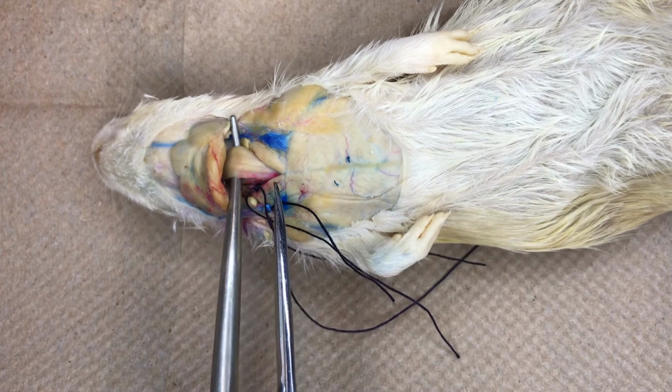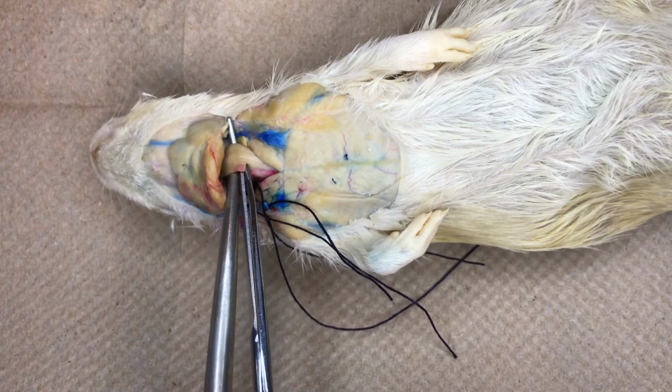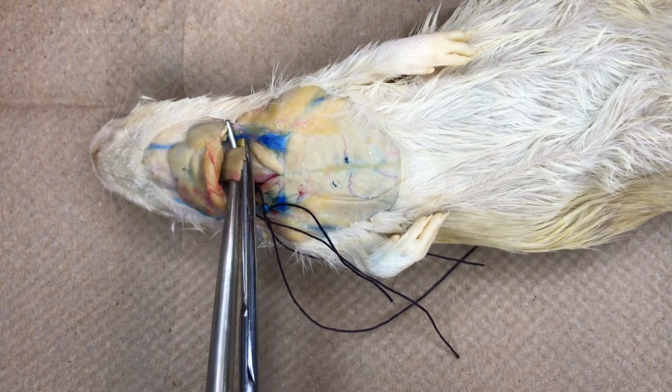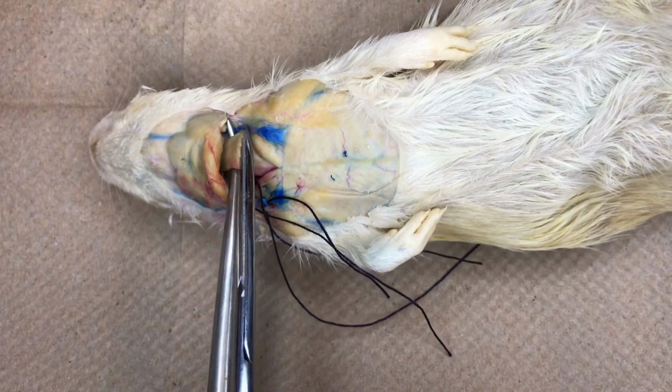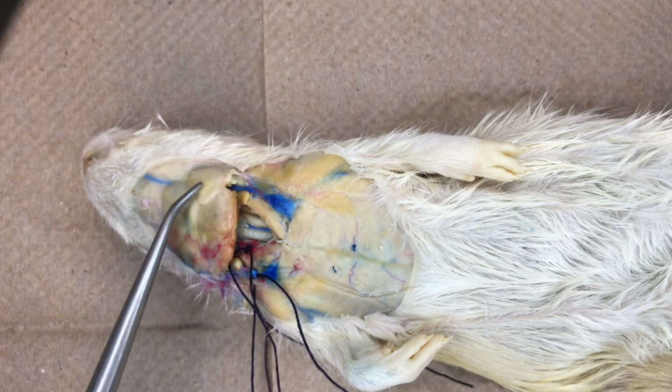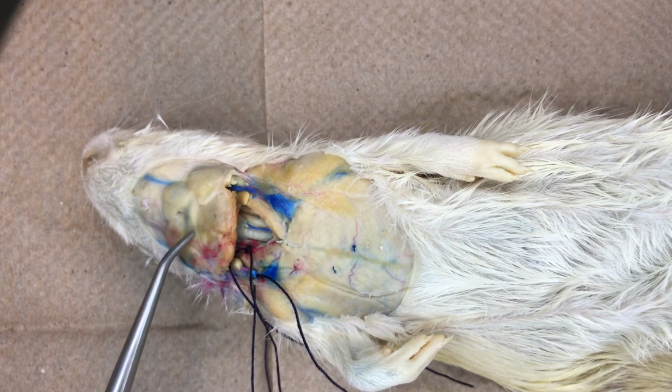To continue our dissection of our rat and expose the neck region, we need to cut the muscles of the neck. Now that we have exposed the neck region in your rat, we can see just under the connective tissue under the skin the most conspicuous pair of salivary glands, the submaxillary salivary glands, one of 3 pairs.